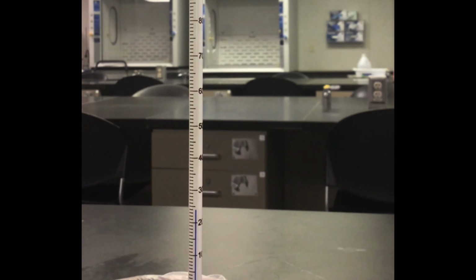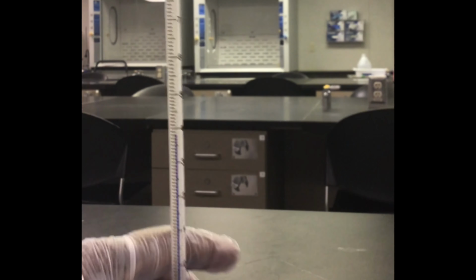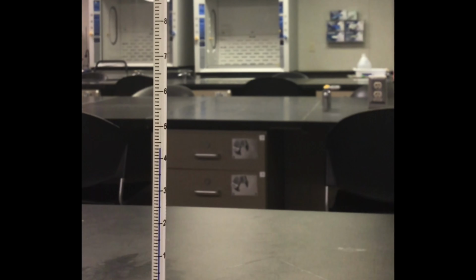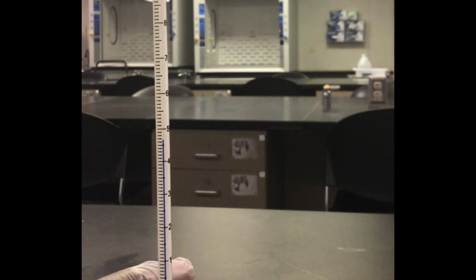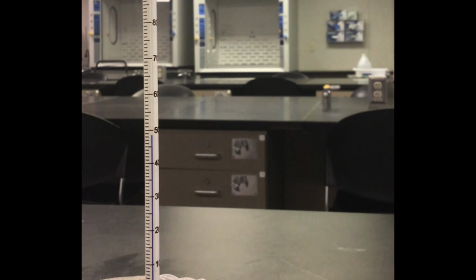Once the magnesium has been added to the calorimeter, you will take temperature readings at 30-second intervals. You will record temperature and time measurements until all of the particles are dissolved. You will use this data to plot a temperature versus time graph similar to the one on page 167 in your laboratory manual.